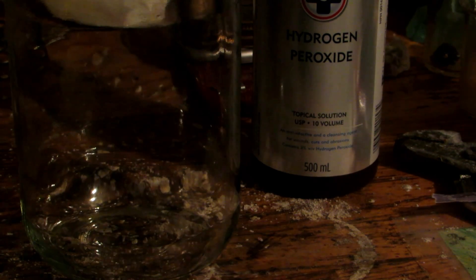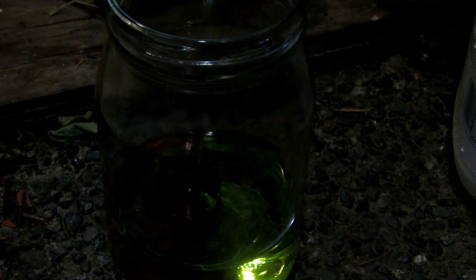I'll meet you outside once I've measured out all three ingredients and put them in this big jar. You can see it's about half full with hydrogen peroxide. We are now outside, and we'll take some hydrochloric acid — sold as muriatic acid, bought at Canadian Tire — and fill it the other halfway so it's just covering all the copper metal so it can react. This should be a sufficient amount to fully dissolve all of the copper, and we are using a large excess to make sure everything reacts. You can always add more copper metal if you'd like to create more copper chloride.